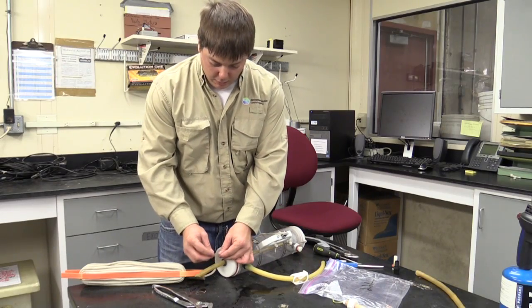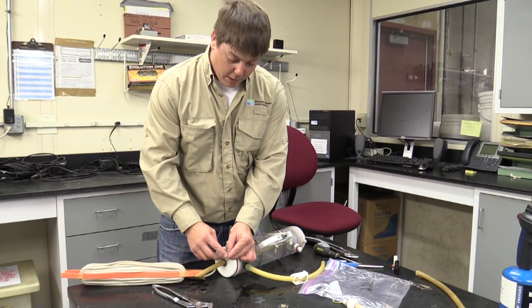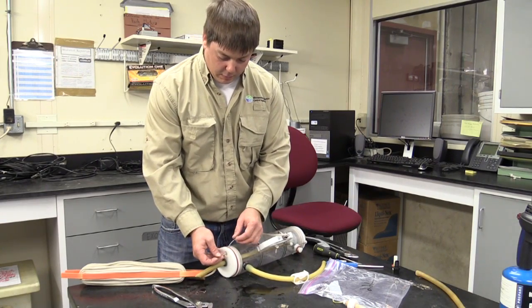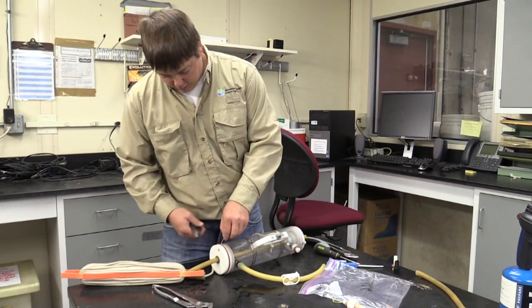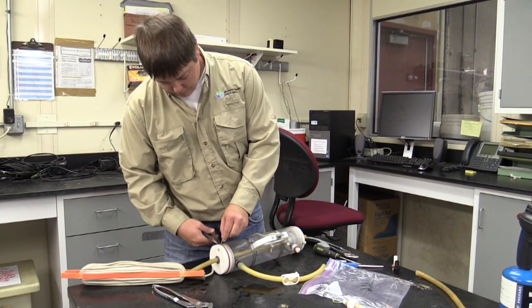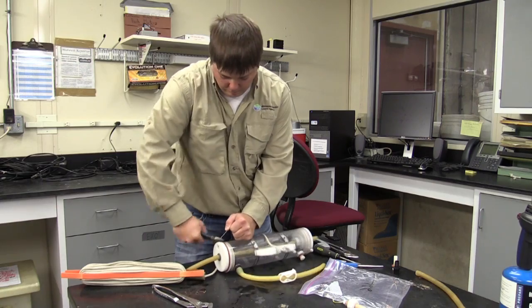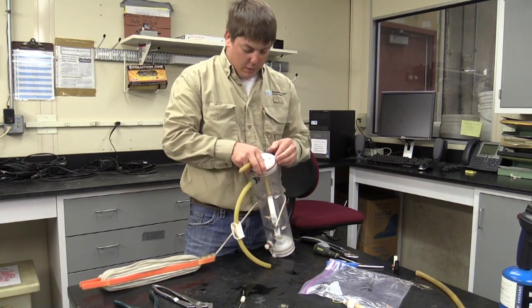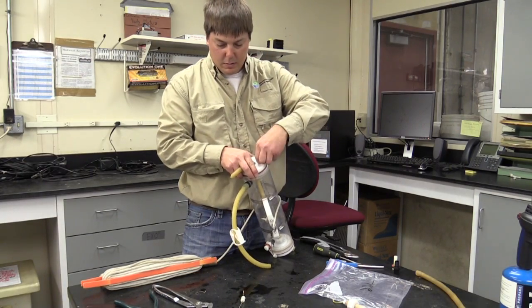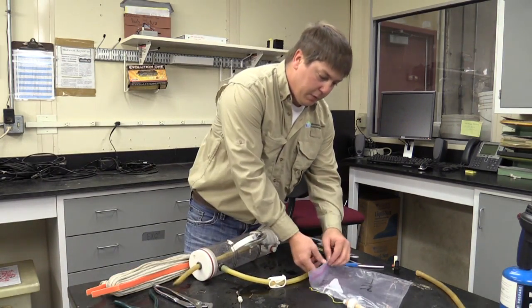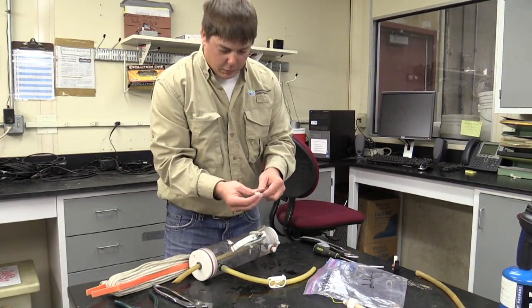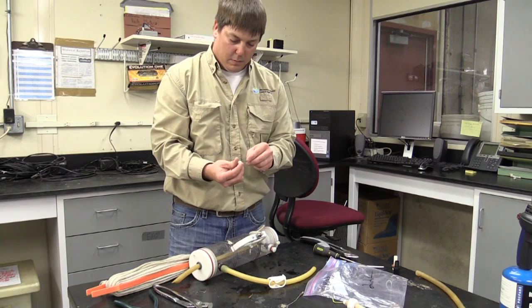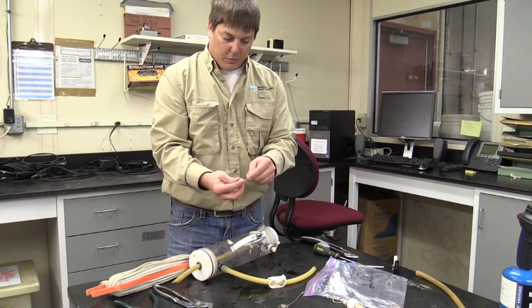To replace the cables, once in a while these cable locks come undone. I'll demonstrate to you here how to do that. You can just take a snips, snip off these. If they're not already broken, a lot of times they'll break themselves in the field. Then what you'll want to do is you'll want to take these little plastic beads off and string them.